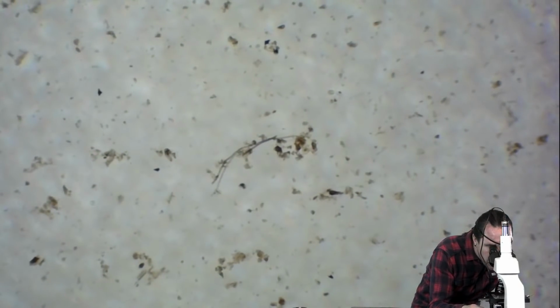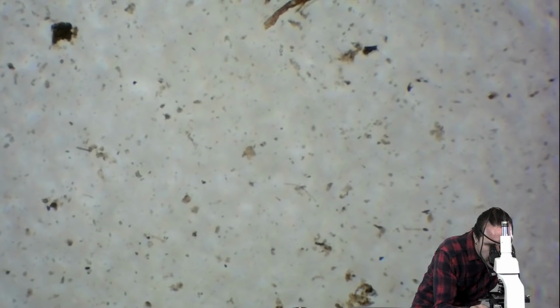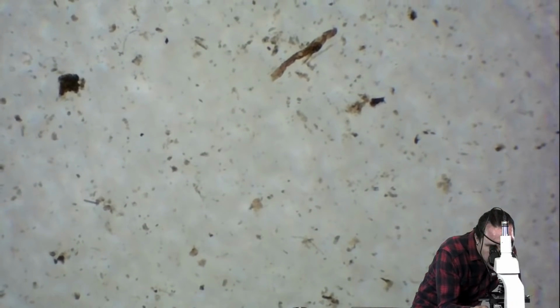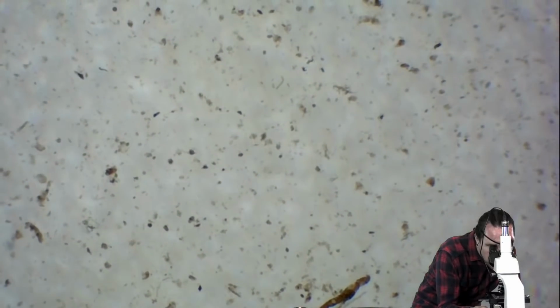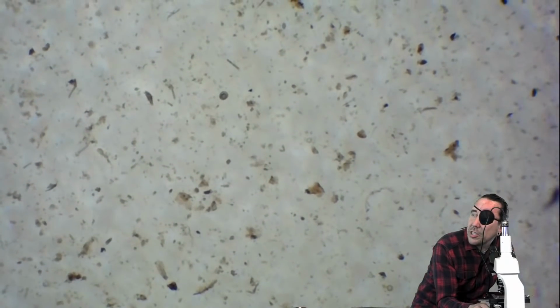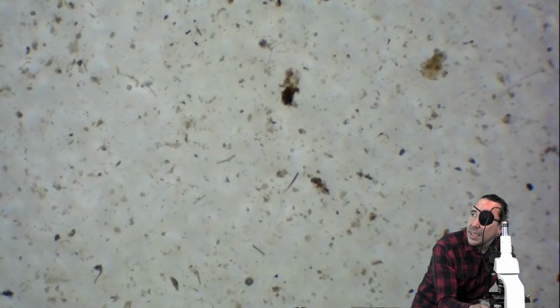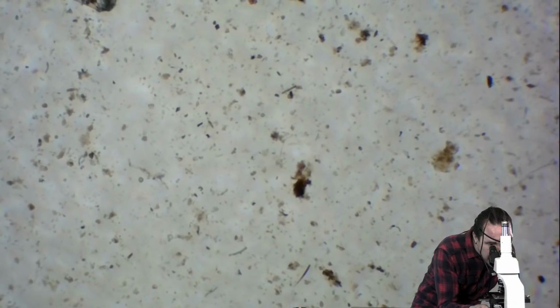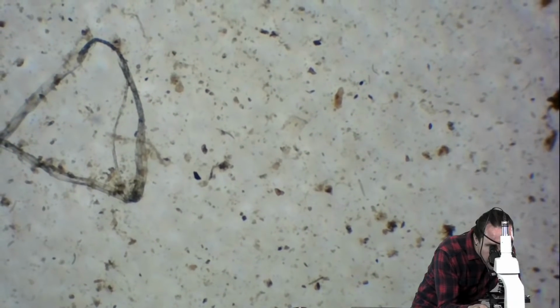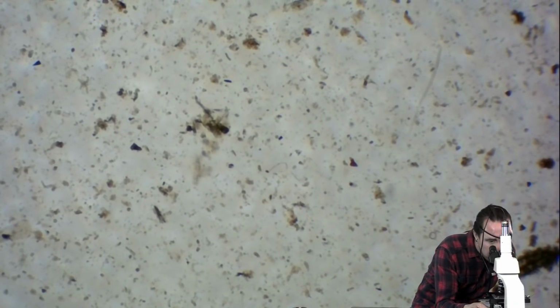It's harder to do with a camera because the camera wants to zoom in and it's hard to show doing a nematode scan. But basically, I'm just doing this really slowly, looking for movement, looking for the shape of a nematode. And I'm not seeing any. But I did see some fungi before. So I usually also make mental notes as I'm doing a nematode scan, because as you're looking through your fields of view, you may not come across fungi, but you can note that you did definitely see some fungi.